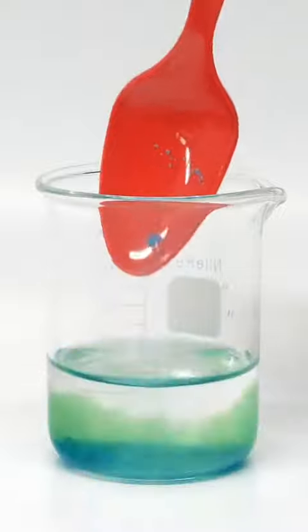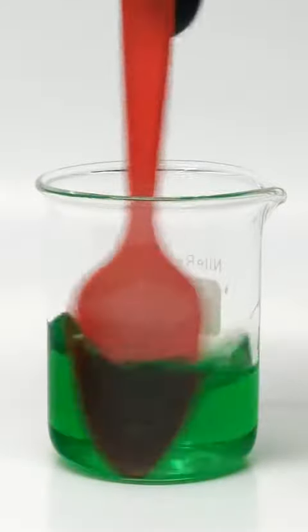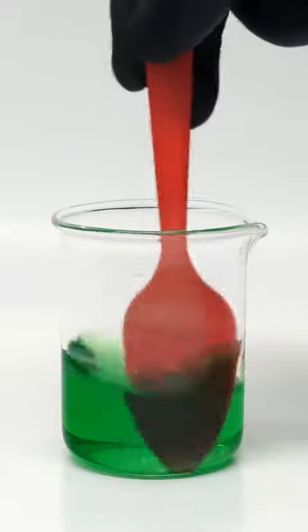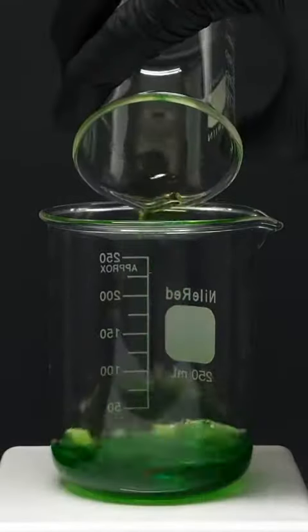Then on top of this, I'll dump in some copper sulfate, and I'll stir it until it all dissolves. What I have now is an acidic copper solution, and I'll pour it into a larger beaker.